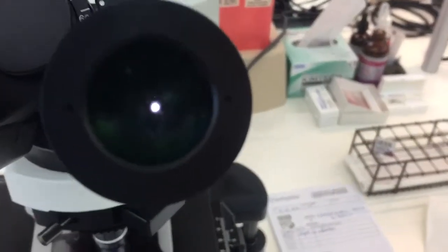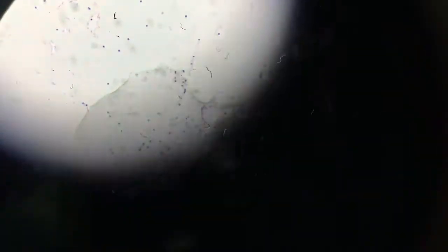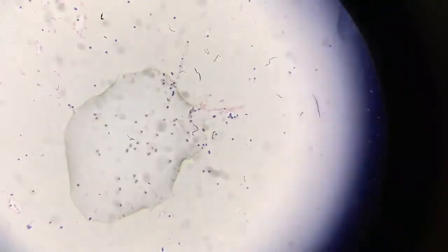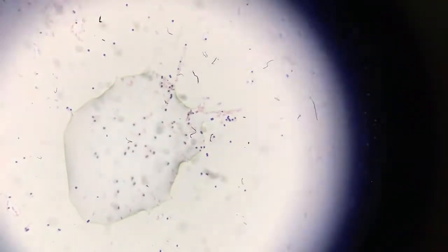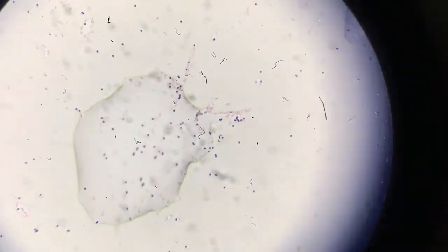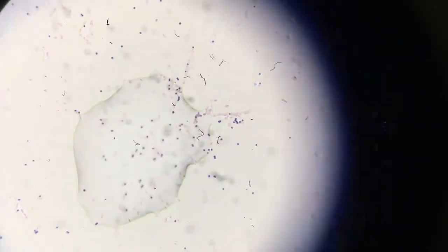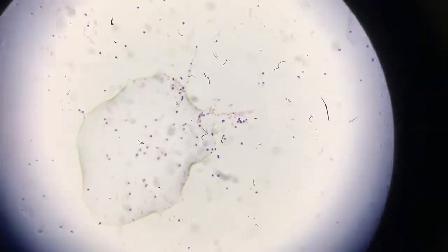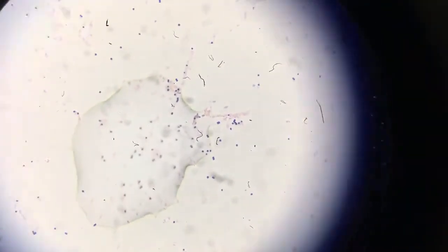Now we can go to the scope. This is a QC slide of both Staph aureus and E. coli. The E. coli is kind of hard to see, but as you can see there are gram positive cocci and gram negative rods under the scope. Voilà — that's the gram stain technique.